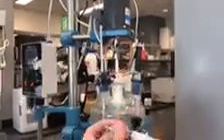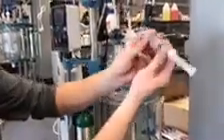Once you've got the sample, you close this valve to not lose the oxygen, and we can now remove this safely without disrupting the gases in here. Now we can put this onto the petri dish or whatever we need to do to analyze it. Furthermore, if we want to pull a sample and to inject it in here, again without disrupting the gases inside, you simply connect this back up, you open this valve, you open the bypass valve, and you simply press it in, and you'll see it spill right off into there. And now you close this, and it is a sealed system still.